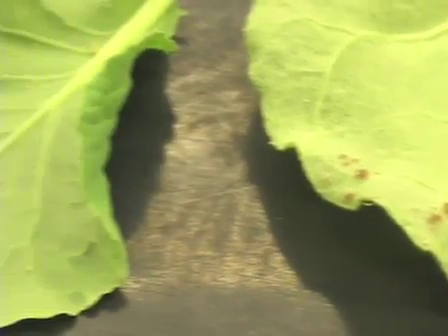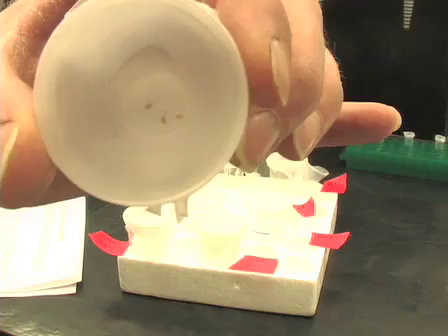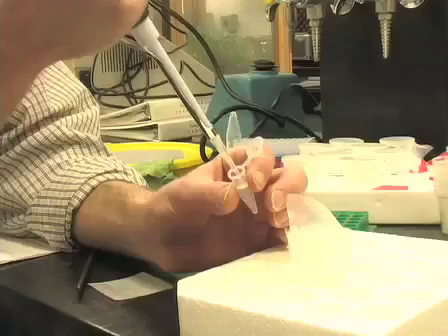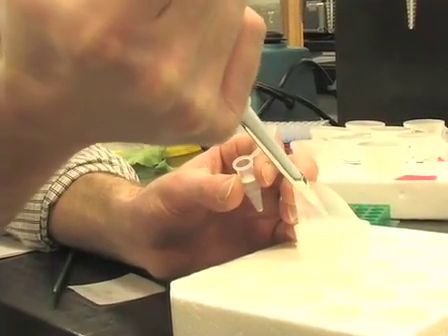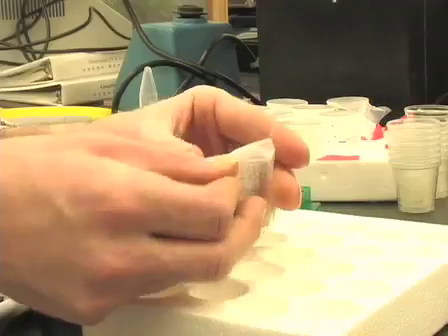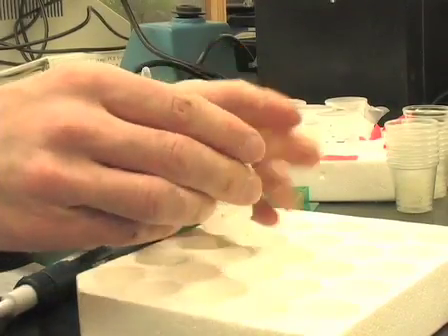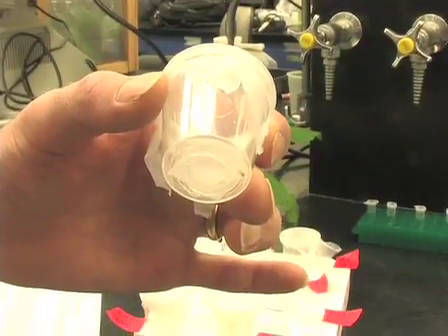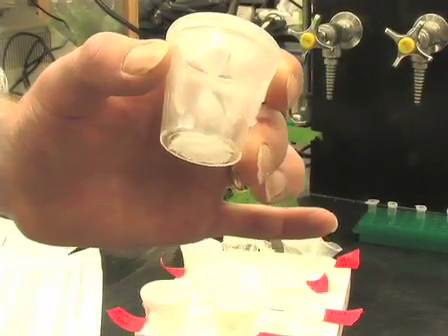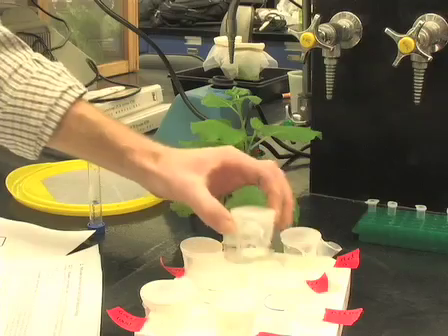In this experiment, four adult aphids are enclosed in a small plastic cup. They feed from liquid diet, pipetted between two layers of parafilm, stretched over the top of the cup. After three days feeding, toxicity of diets containing different concentrations of nicotine is compared to control diets, by counting adult and larval aphids in each cup.